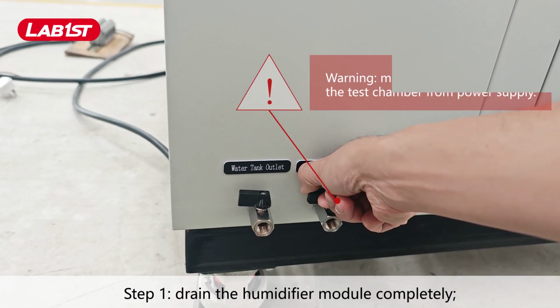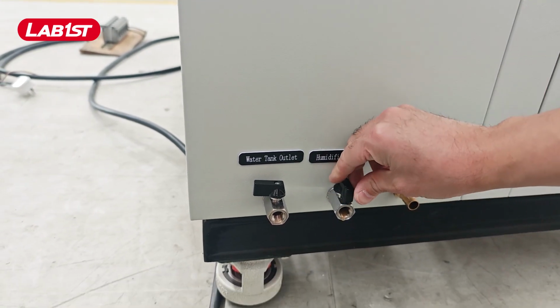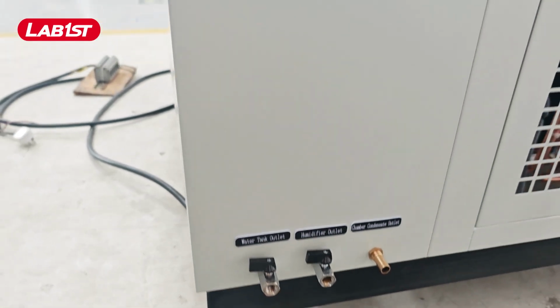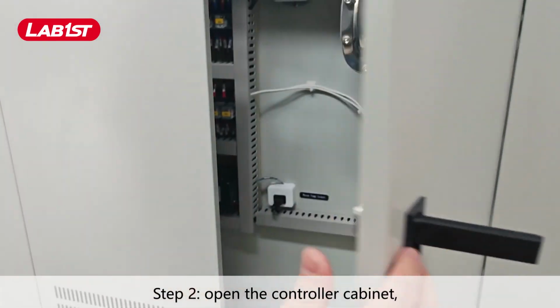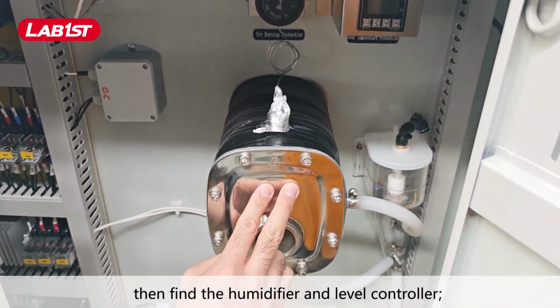Step 1. Drain the humidifier module completely. Step 2. Open the controller cabinet, then find the humidifier and level controller.